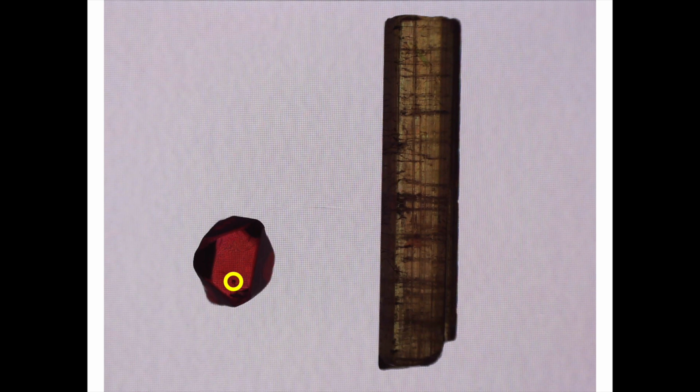And this will be useful to us a bit later. Well, overall, spinning around the spinel was pretty boring, so let's get rid of that for a moment, and now let's focus on the tourmaline crystal. As the tourmaline crystal rotates in plane polarized light, we see a completely different behavior.